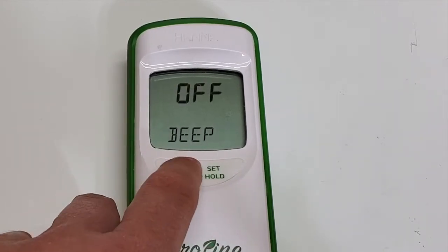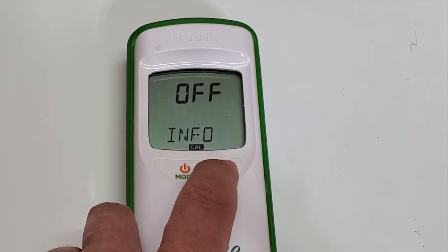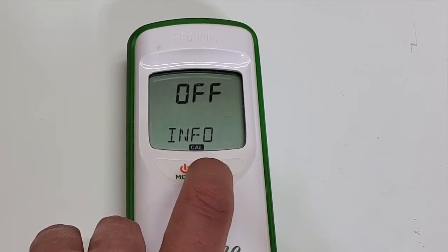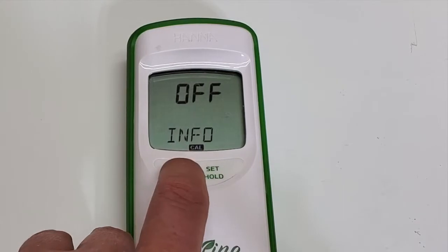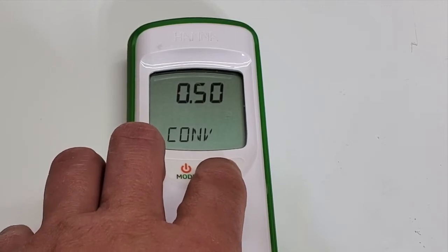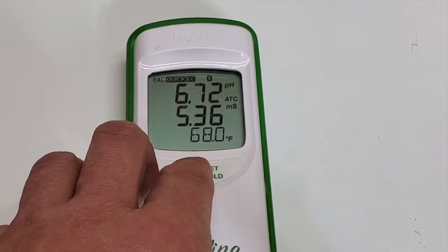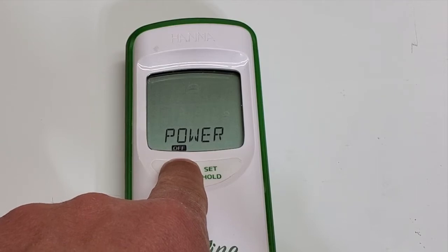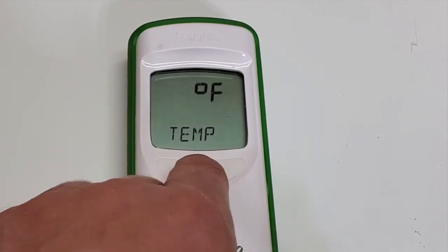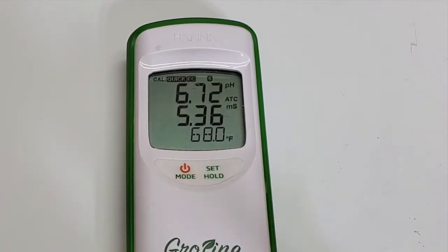Quick cal or standard calibration — we'll get into that a little bit down the road. Beep — turning it on just for demonstration. This is probe info; it can only be done when it's in standard calibration, we'll get into that function a little later. Here's the conversion factor if you want to run PPM for total dissolved solids — it's either the 500 or 700 scale — and then it just brings you back out to the main screen.